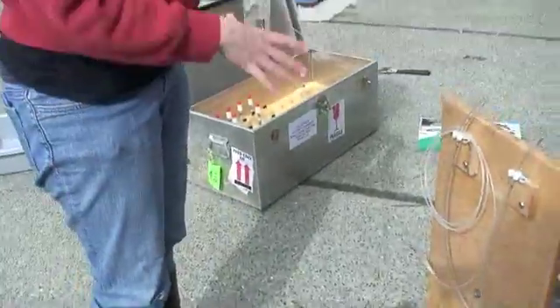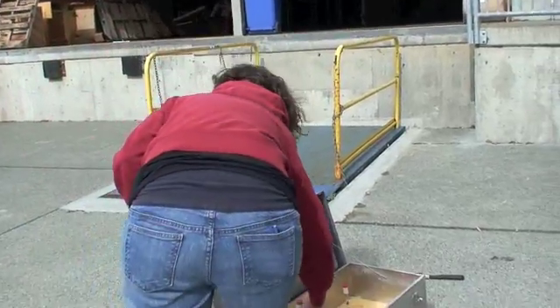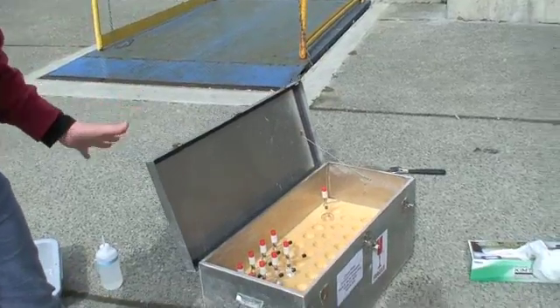So we're all done with the sampling part for now. Let's go back to the box, but in fairly short order we want to clean out the flask necks and prepare them to be shipped back to us for analysis. So we'll show you how to do that in the lab. Okay, here we are back in the lab.